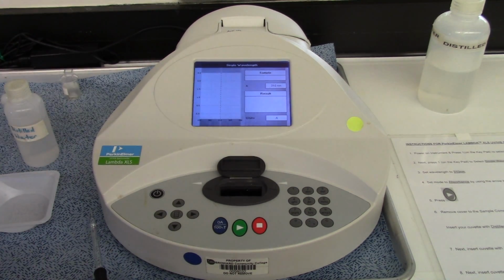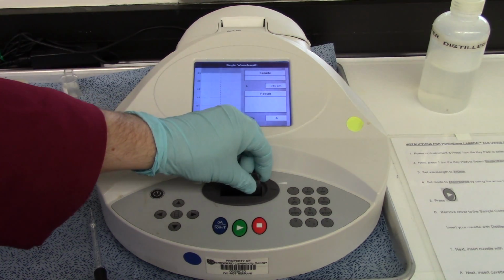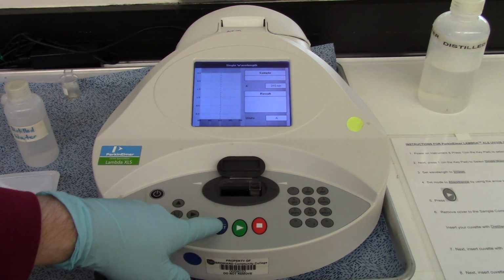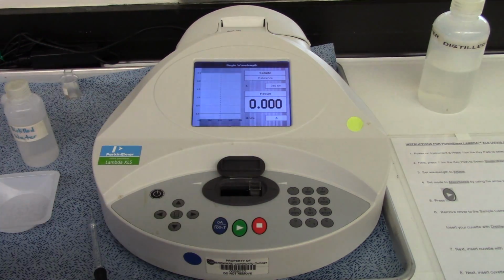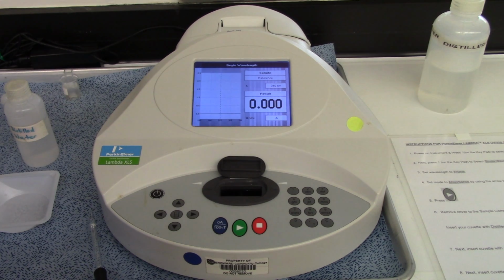The computer inside this machine is going to take the absorbance of this water and zero it. In other words, we're going to make sure that whatever absorbance we're reading is the absorbance of our vitamin C and not the solvent that we're using, because we don't really care about the solvent. So I'm going to hit re-zero right here. The machine is zeroing itself so that water won't give any readings. And as you can see, it's 0.000 because the solvent has been zeroed out. The machine is not going to register the amount of water. Okay? So there's my blank.